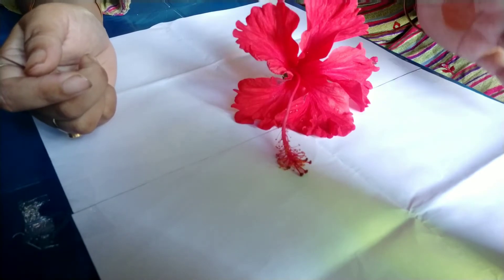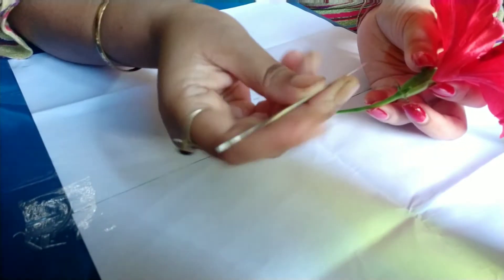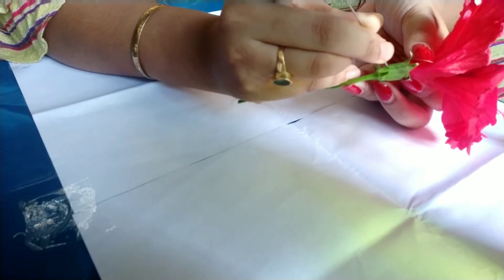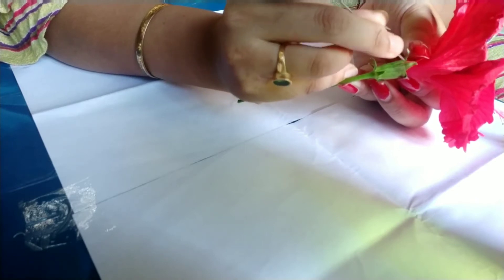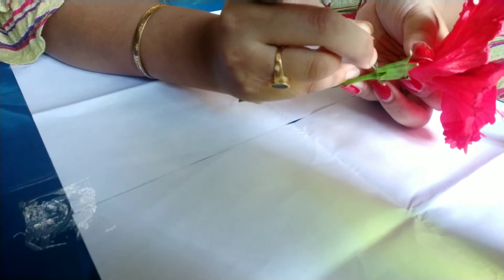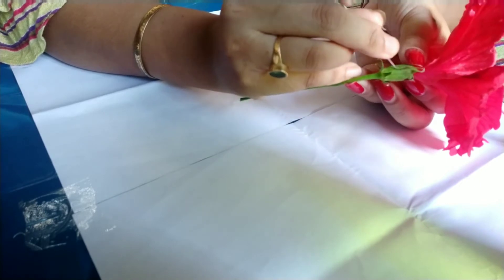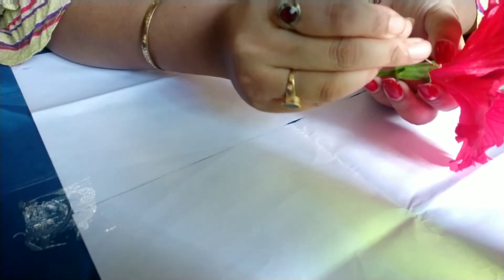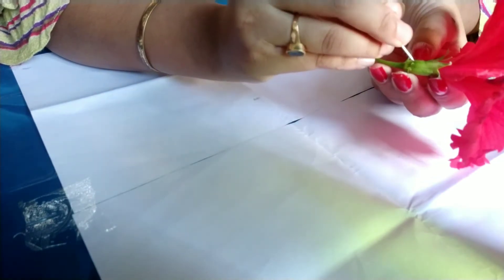Let's start with the lower part, that is the sepal. I'm dissecting it using a small medium-size needle. I will make a small cut. Be careful while holding it — you don't have to put much extra pressure. For doing your dissection, you can use a blade instead.